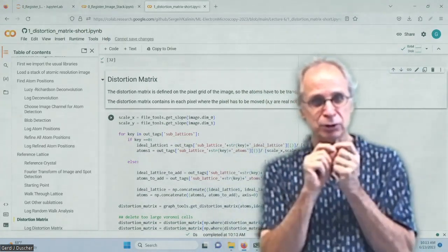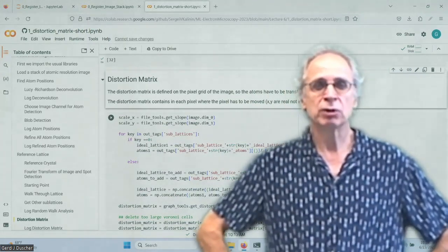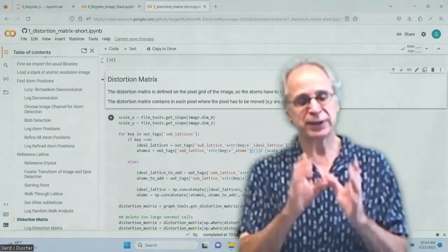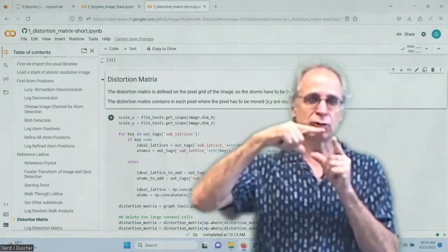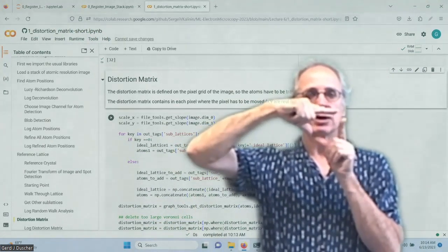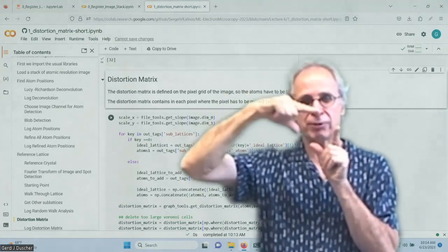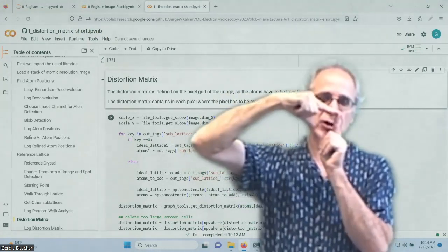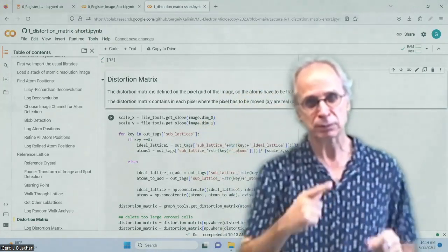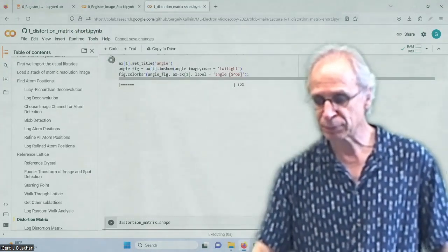I have the information of here's an atom and it's supposed to be over there. So this is part of a deformation matrix. But what I really want to do is I want to determine that for each pixel. What I'm doing is I'm using a Voronoi tiling of all the atoms. So I have an area that is unambiguously associated with one atomic position. And I have the neighboring ones as well, so I know how it is distorted. So what I'm doing is I undistort that Voronoi cell and then place it where it needs to be. So I can get a position for each single pixel at the right scale.